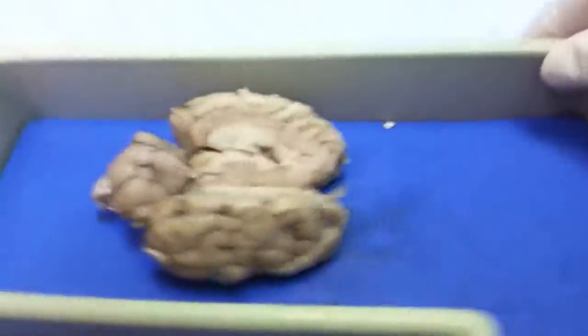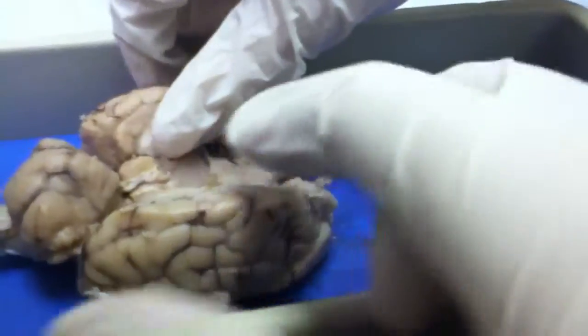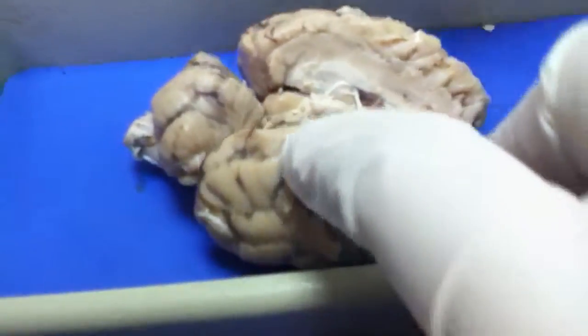Touch it, feel it. Focus. It's so weird. That's cool. Open up, you can see the ventricles. It holds the blood — it's the brain blood. It smells so nasty. That blood stuff that he was taking out — what is that? It probably is blood. These little tiny things are capillaries, blood vessels. This is so cool.